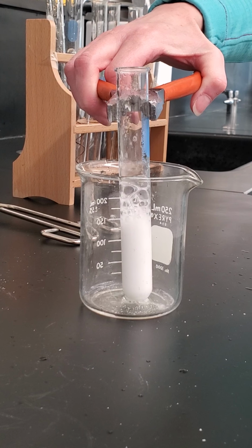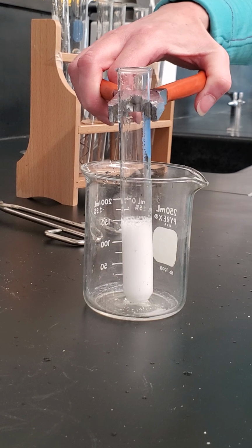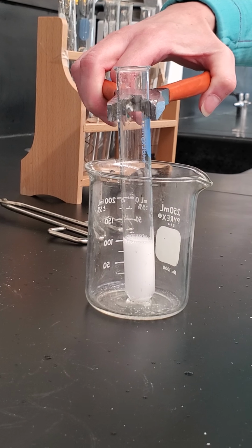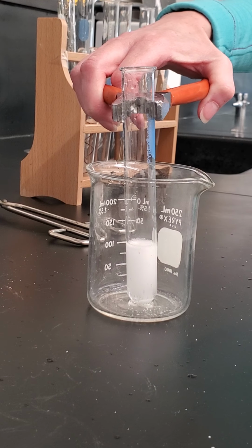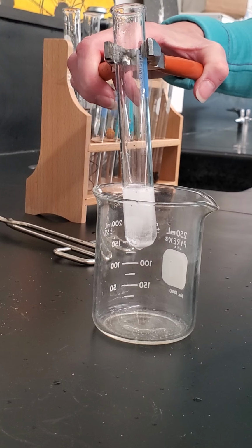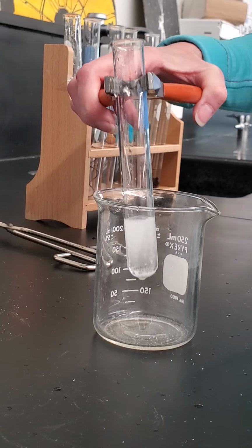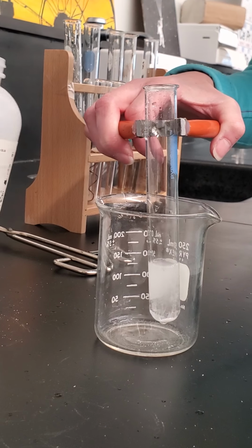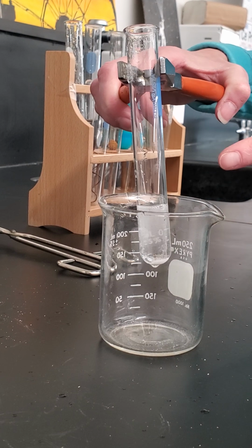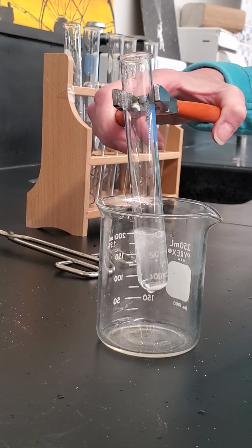And so as you can see, when the sodium carbonate hits the hydrogen sulfate, there is a double displacement reaction, and we do get two products formed. In solution here, we have sodium sulfate. That is sodium from the solid and sulfate from our aqueous solution.